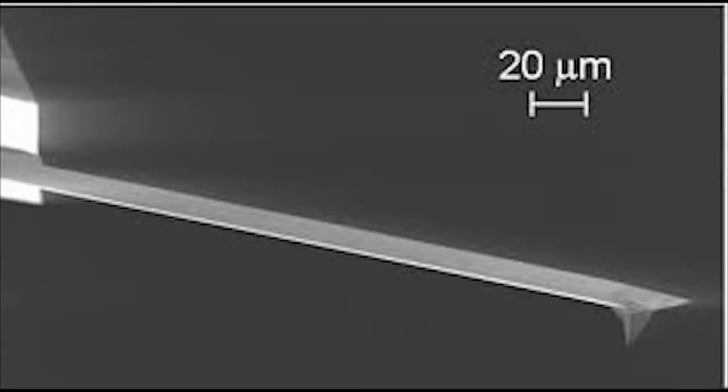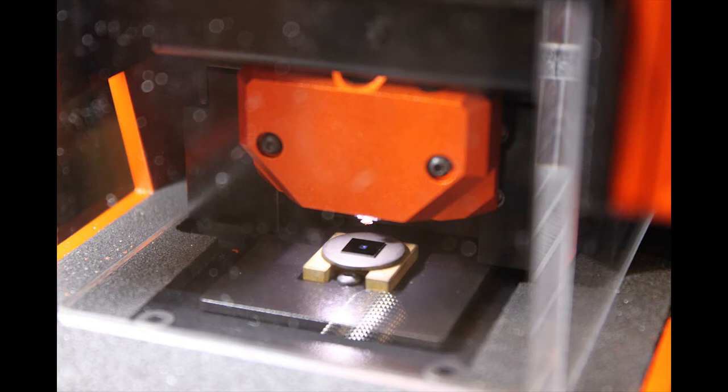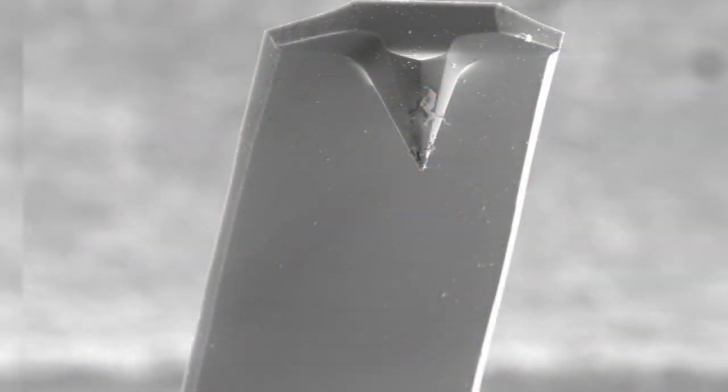Smaller cantilevers were developed in 1996, allowing higher resolution and smaller scanning times. The Hansma group began developing a new generation of AFMs that would utilize these smaller, lighter cantilevers. For biological samples, desirable cantilevers have a higher resonant frequency, and therefore a higher scanning speed, and a lower spring constant. This is most easily achieved by decreasing the mass of the cantilever. Recently, cantilevers have been fabricated on the order of 9 to 40 micrometers in length and with resonant frequencies an order of magnitude higher than commercially available cantilevers.